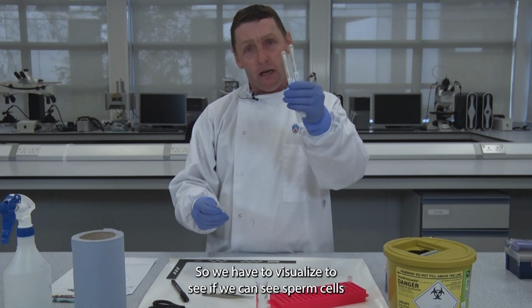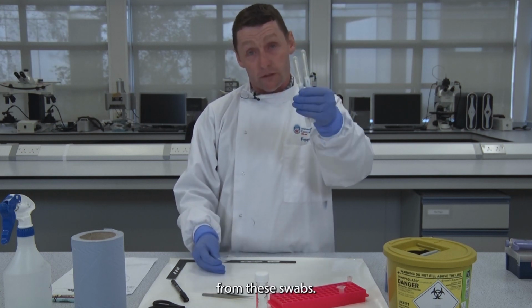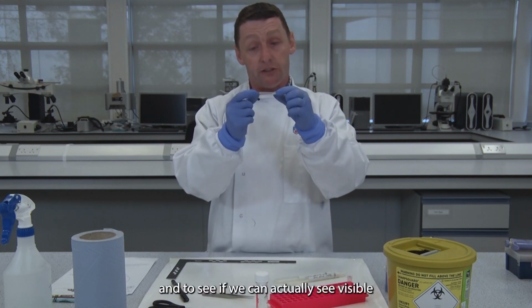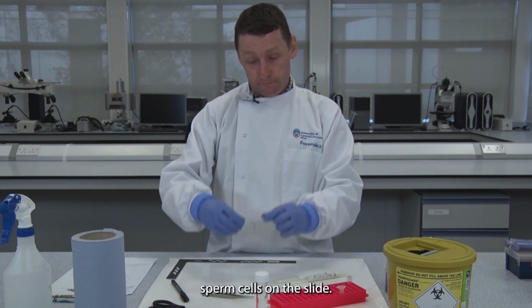So we have to visualise to see if we can see sperm cells from these swabs. And the only way to do that is using a histology slide, and to see if we can actually see visible sperm cells on the slide.